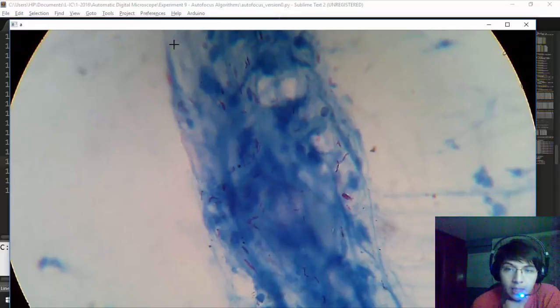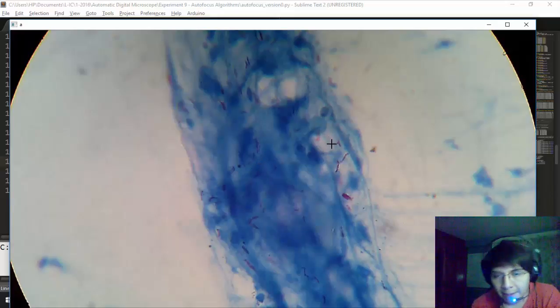This is one of the images that we have taken with the automatic digital microscope, and as you can see, this is the best focus that we can acquire with our microscope. You have to remember that the microscope we are using is one that we took from an old hospital, and they don't use it anymore at Cobija. I want to emphasize that with our devices we can make diagnostics even with this old equipment that hospitals don't use anymore. As you can see, this patient has a lot of infection, and that's going to be the topic of another video. But this is the image that we're going to work with for the autofocus.